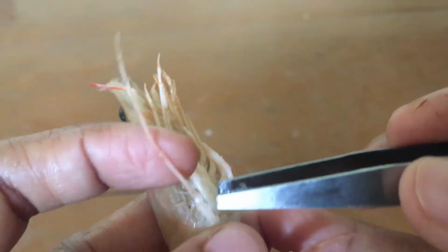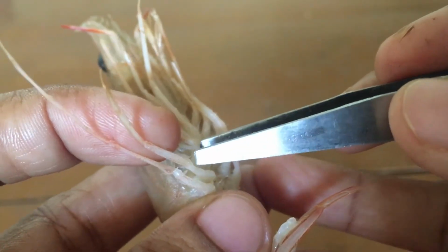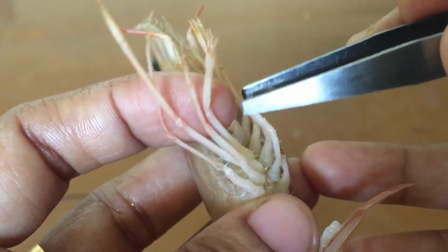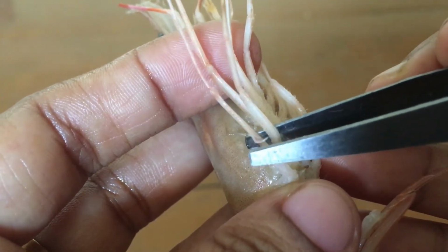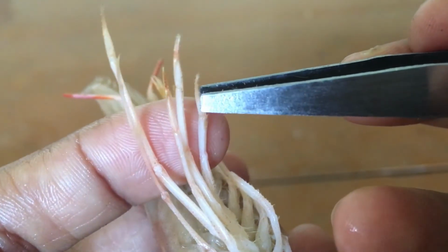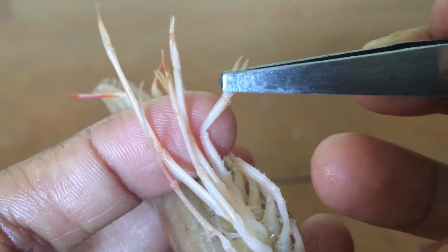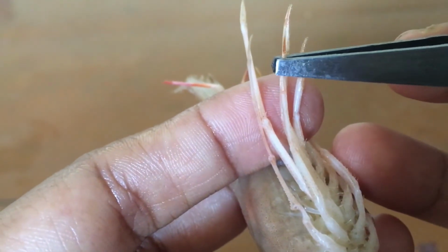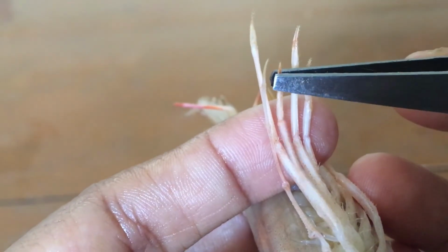This is the 5th walking leg, and this one is the fourth one. Then the third one, the second one, and the first. So 5 walking legs are there in the thoracic segments. Among these, the first 3 possess pincers, bifurcated ends that we can see here. I will show you. These are pincers. The first walking leg possesses a pincer, the second one also, and the third one also has a pincer. So the first 3 possess pincers, so they are called chelate legs.